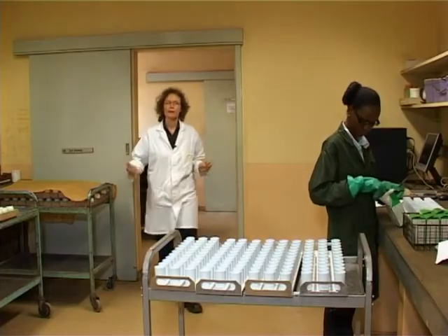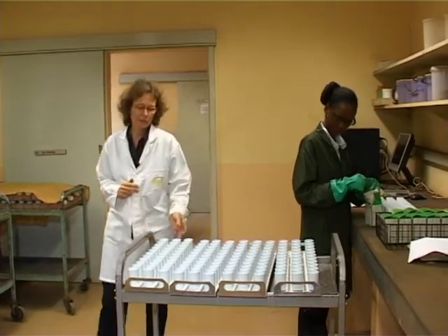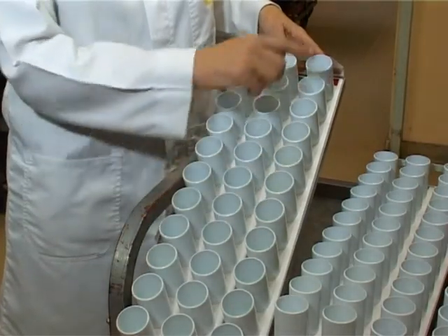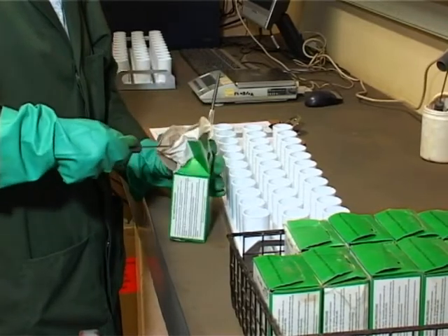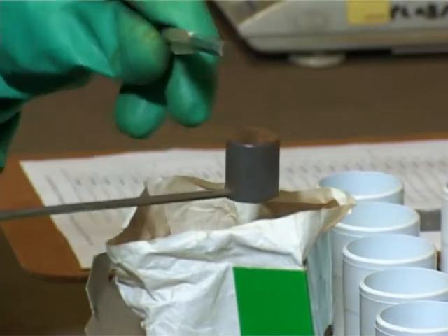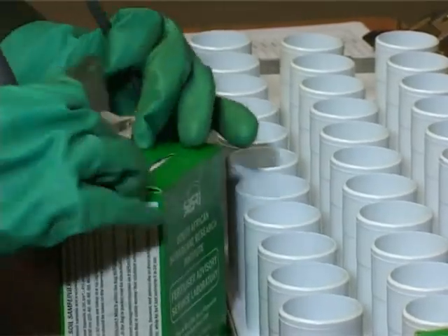This is the sample preparation room. From here, samples follow five different routes through the laboratory for analysis. In a new development, trays of samples are processed in small batches, allowing for stricter quality control. In each row of 11 cups, we include a blank and a control sample of known value. A known volume of sample is scooped for each different analysis. Previously, all samples were weighed, but results will now be expressed on a volume basis, which will reduce any error arising from soil texture variability.